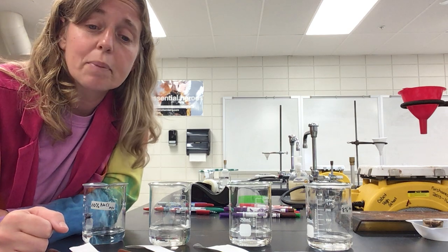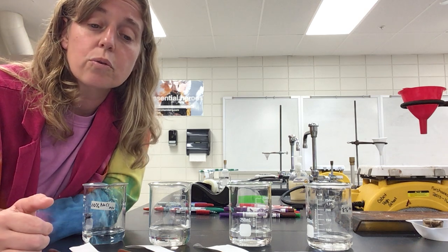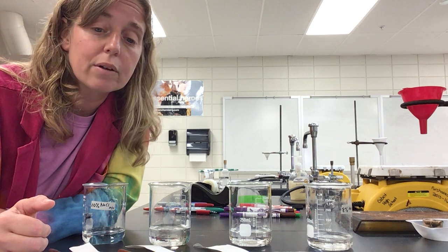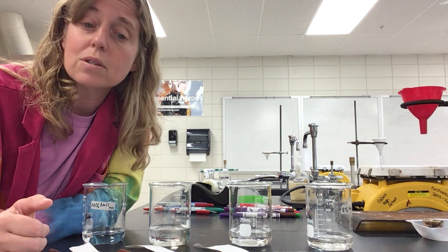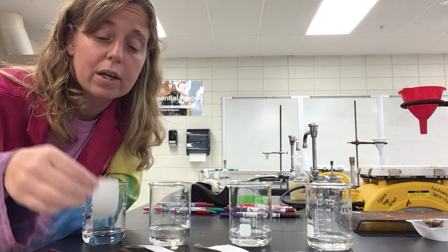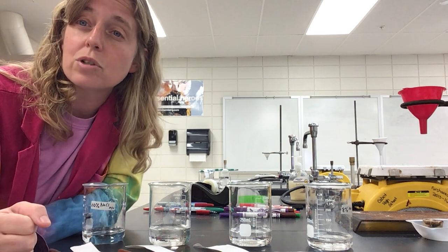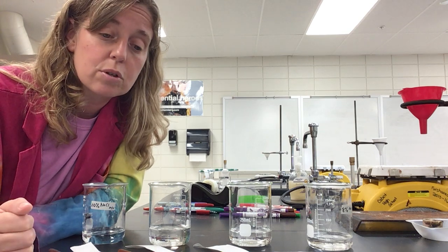For example, many black inks contain several colors. When the water flows through a word written in black, the molecules of each one of the colors responds differently to the mobile phase, which is the solvent, and the stationary phase, which is the paper. So the paper is going to be your stationary phase because it's not moving, and then the water is traveling up the paper, so that's why it's your solvent, because it's actually moving and separating the mixtures, okay?